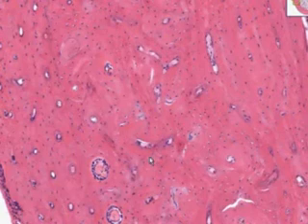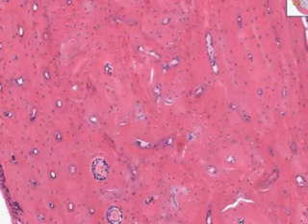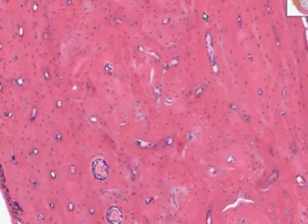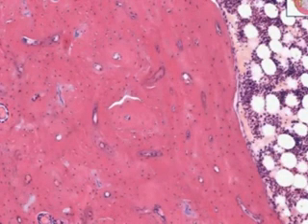Branching off at right angles, possibly here, possibly here, possibly here, from these haversian canals are what they call transverse or Volkmann's canals. And all they represent is just some more vascular connections between the main or haversian canals. So we see periosteum, endosteum, and all of these little haversian units. Let's take one like here, for example. That's a good place to start, and blow it up to its highest power.